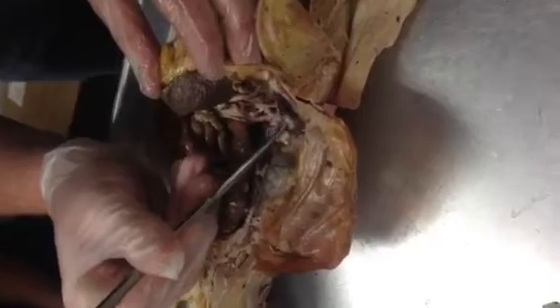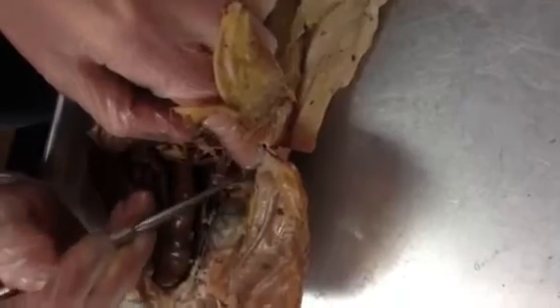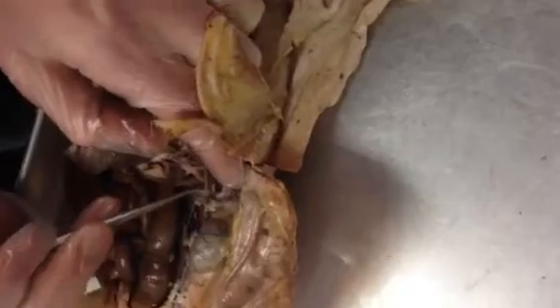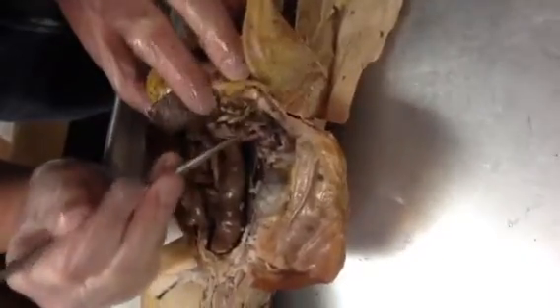I need to remove some of this fascia. It was hard to find on ours. Keep working on this guy. Yeah, usually it's like a nice little bean. But, okay, so there's also a vein and artery that run out to that. The adrenal vein and artery. And, yeah, that could be it.